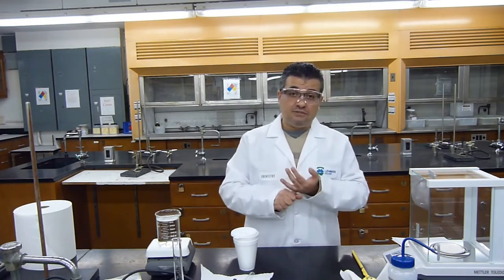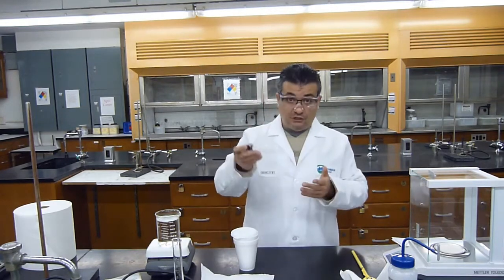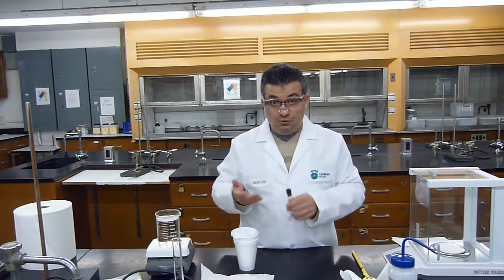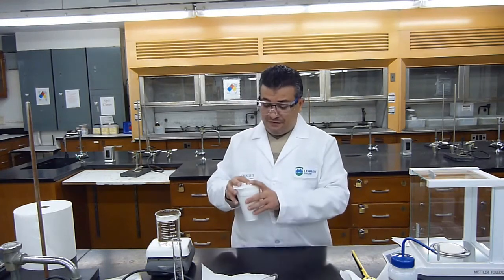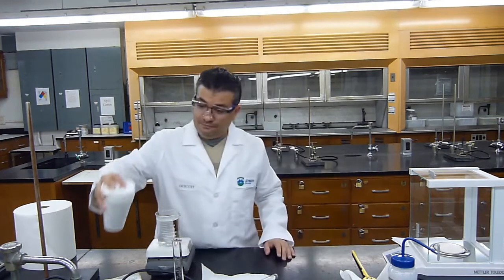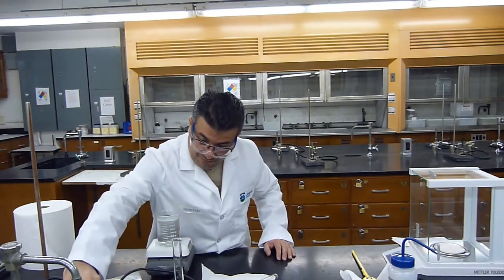If we don't lose any of the metal, we could keep the same mass of the test tube, because the test tube's mass, empty, will not change. If I don't lose any of the metal, the mass of the metal will also not change, and I could reuse that. So I'm going to be very careful. I'm going to pour out my water without losing any of my metal.